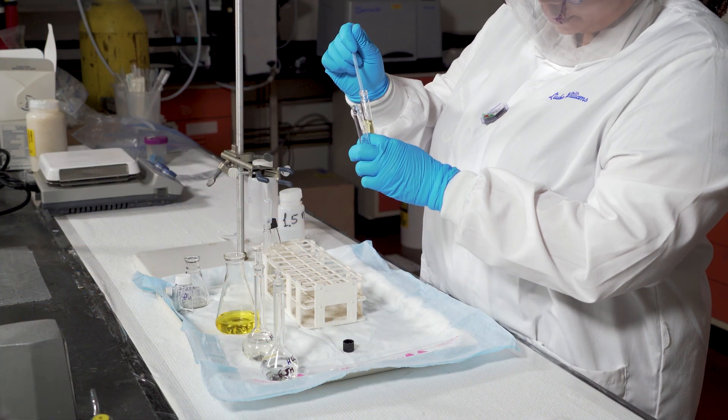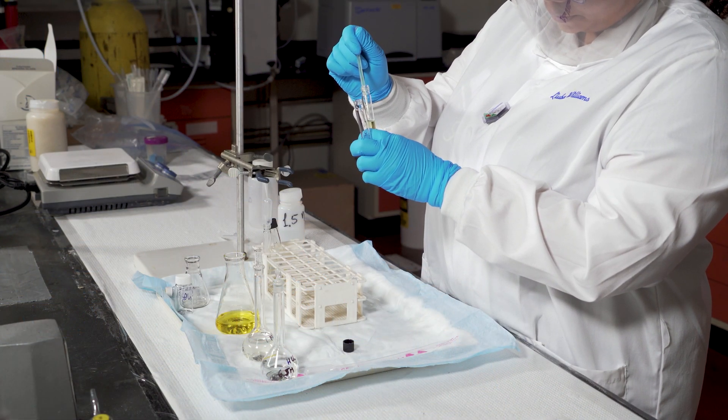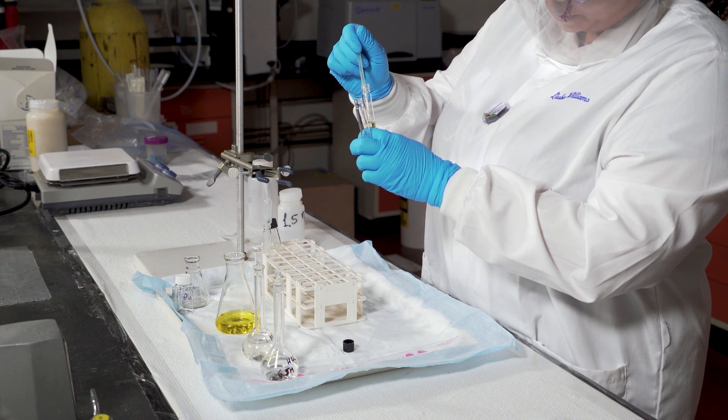Using a pipette, the organic layer was removed and transferred to a separate centrifuge tube containing 0.01 molar nitric acid.